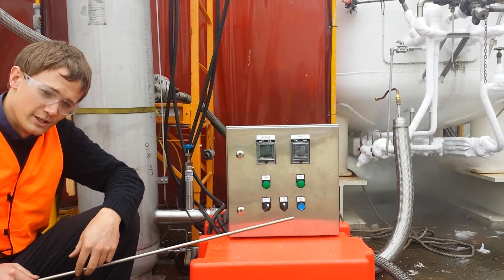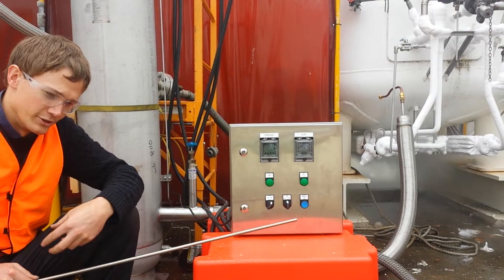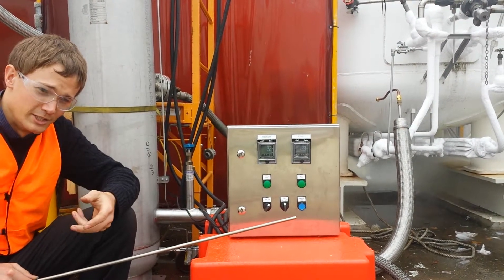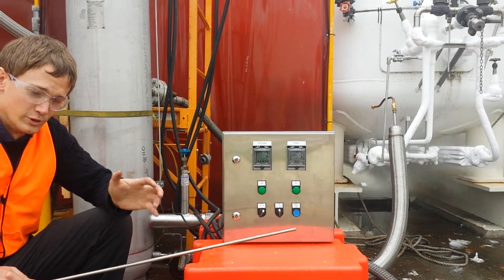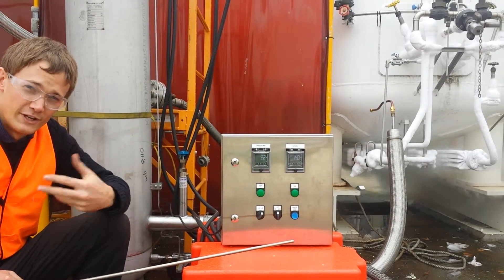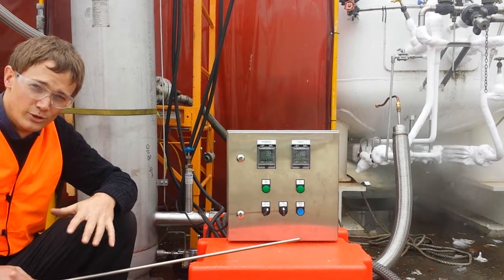which is what you would have the CryoBuddy set to most of the time. That's where the CryoBuddy really functions the way it's designed to. You'll get a high pressure liquid source coming in and the CryoBuddy will lower the pressure and vent out all the excess gas automatically.